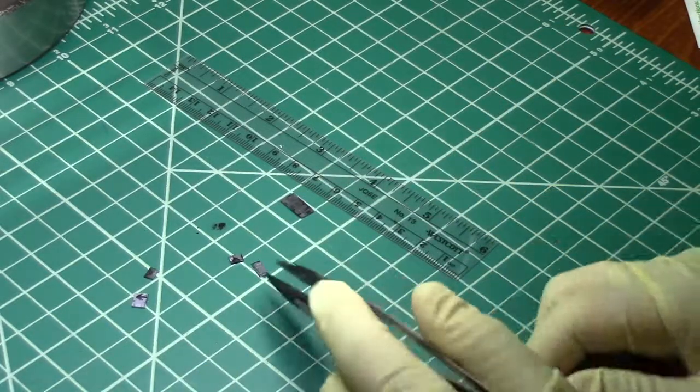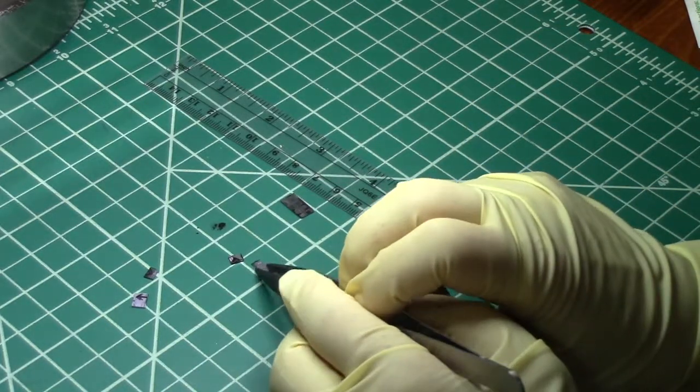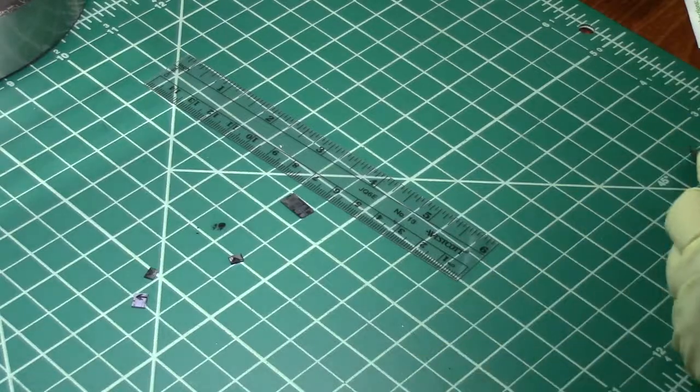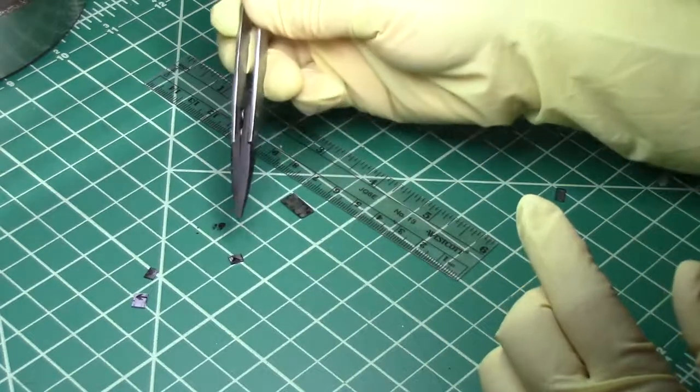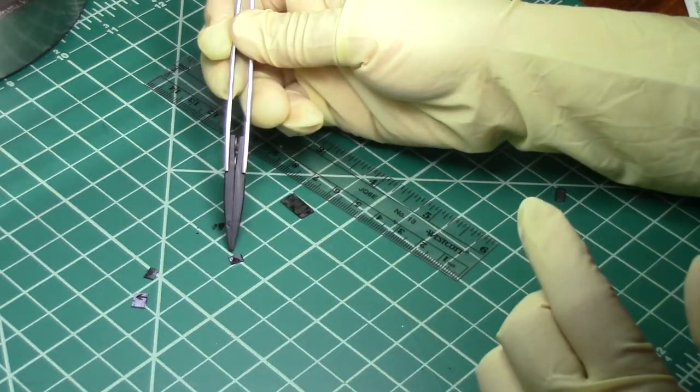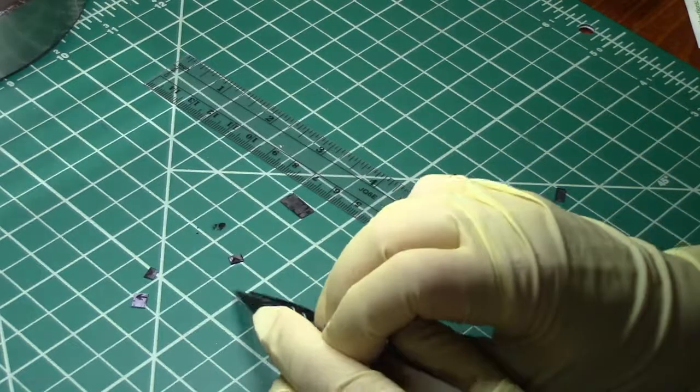And there I have another small sample with the edge that I want to put in the SEM, never touched by the tools.